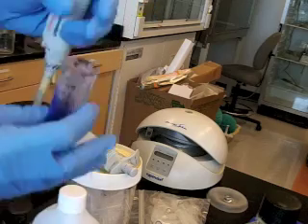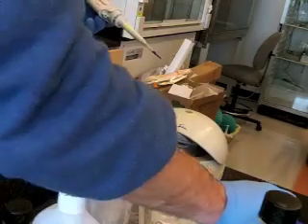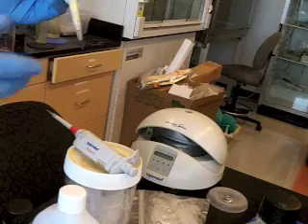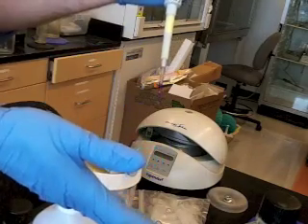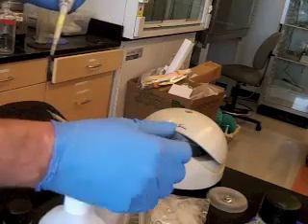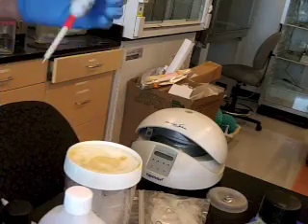So for example, let's say we have a tube, we're going to put 100 microliters of water in it. Let's put the 100 microliters of water in it, and then we'll put in the smaller volumes, maybe 10 microliters of a buffer, maybe 1 microliter of an enzyme, like that. Because the small volumes, instead of just squirting them into the tube, we'd like to eject them directly into the target volume. So we'd like to add 100 microliters of water, and we can do a little of that right now.